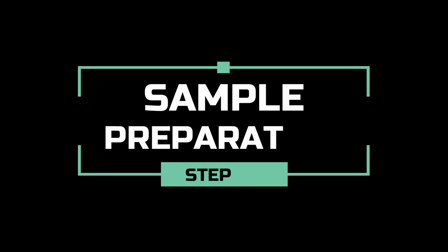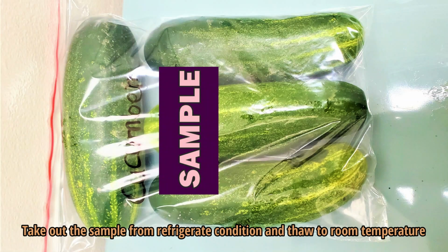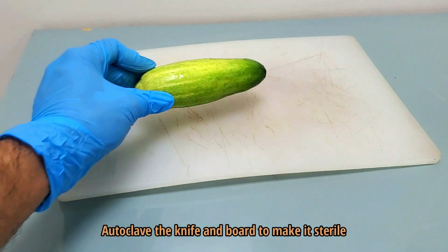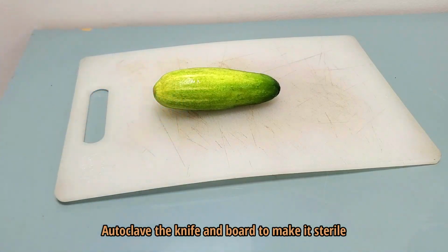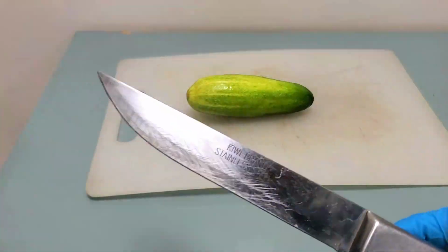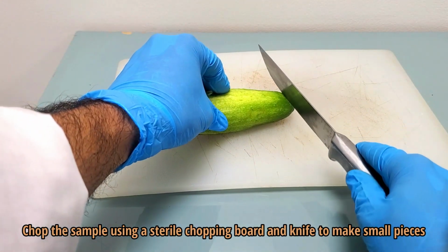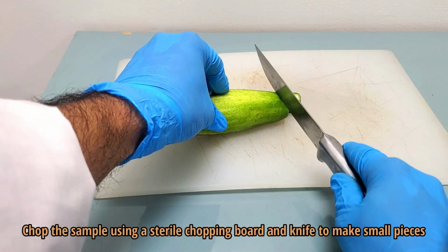At this point, we will prepare the sample. Take out the sample from refrigerated condition and thaw to room temperature. Autoclave the knife and board to make it sterile. Chop the sample using a sterile chopping board and knife to make small pieces.